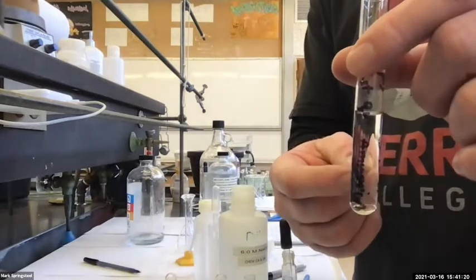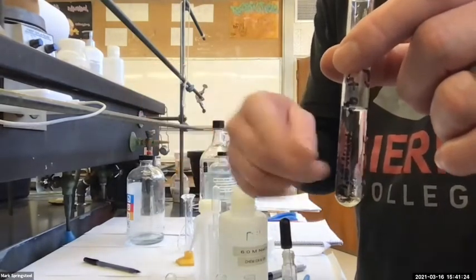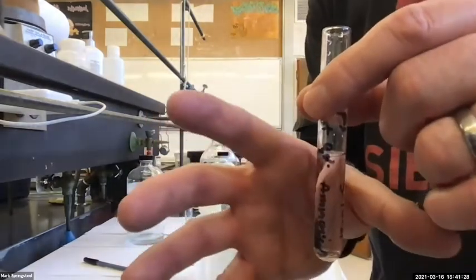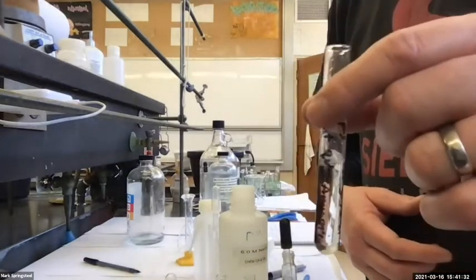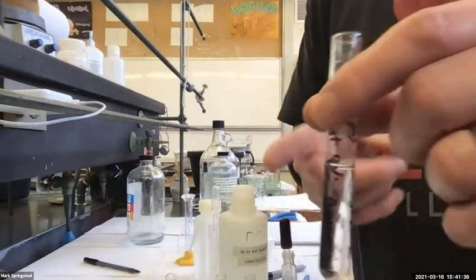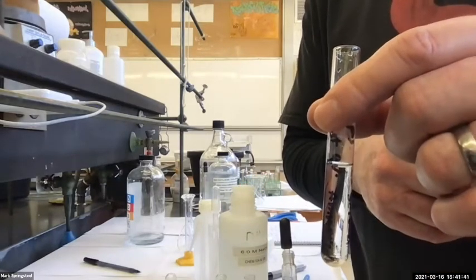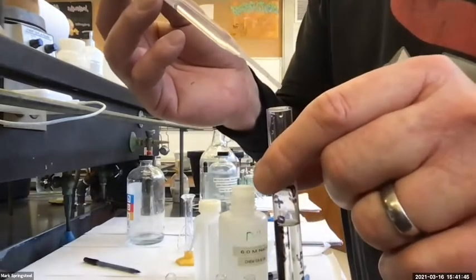All of the ammonium gets deprotonated there, and it becomes a no-charge organic and precipitates. But then excess hydronium rushes in and reprotonates it again, making it soluble again. Do you think I've gone to the point where the solution that was acidic, it was pink, is now basic yet? Not just yet. We've got to keep going.